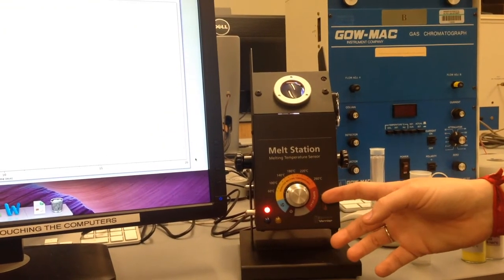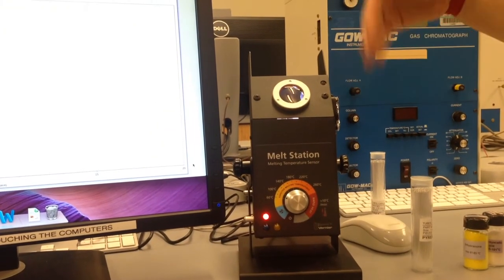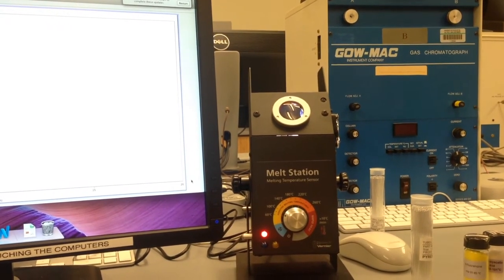There will be a thermometer where you can monitor the temperature. The thermometers may either be a digital or traditional glass one. This meltemp uses a digital one.